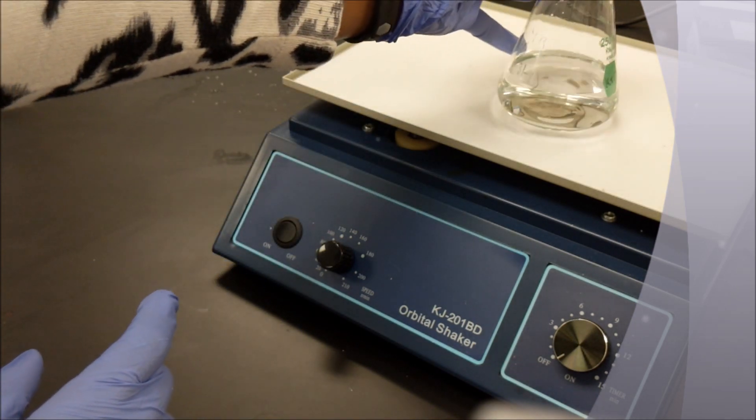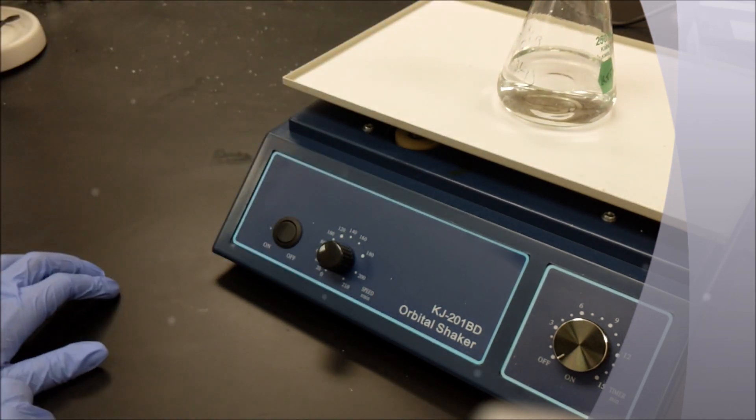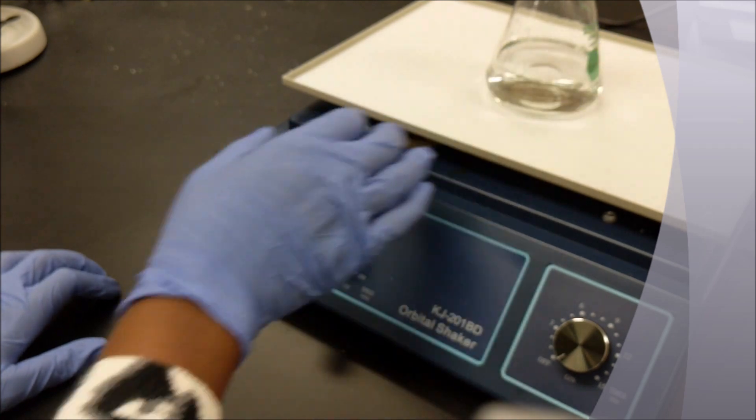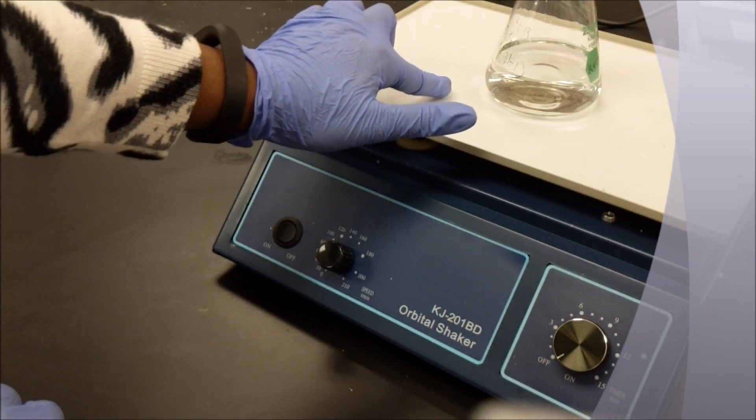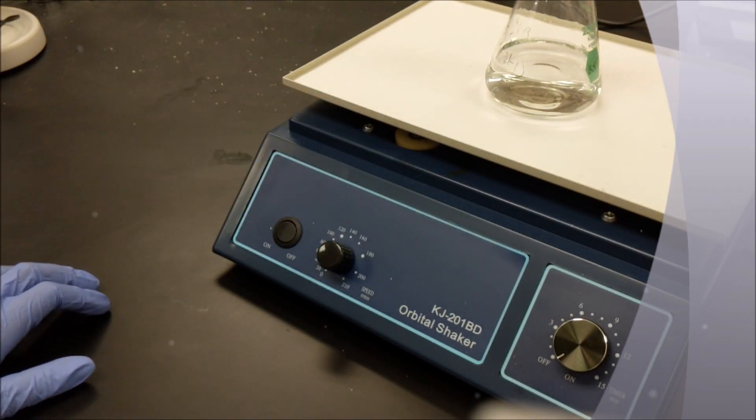Once properly prepared, add the flask onto the shaking platform and ensure that the shaking platform is dry.